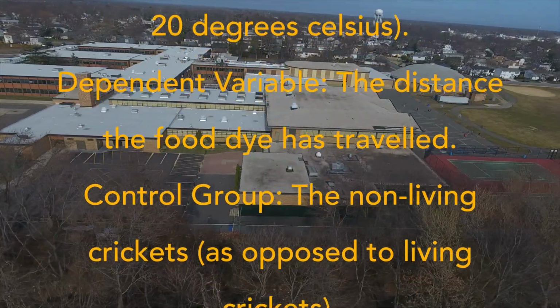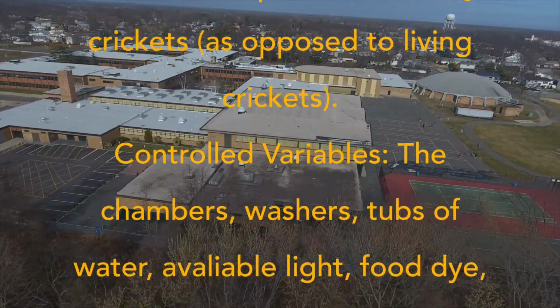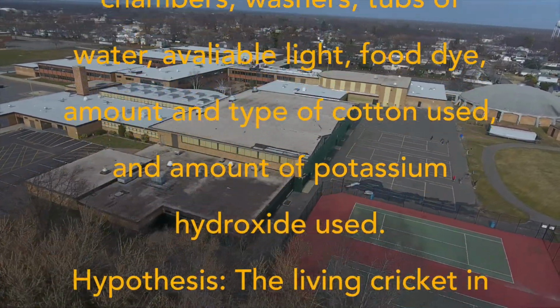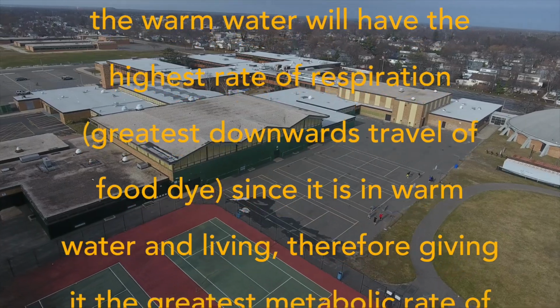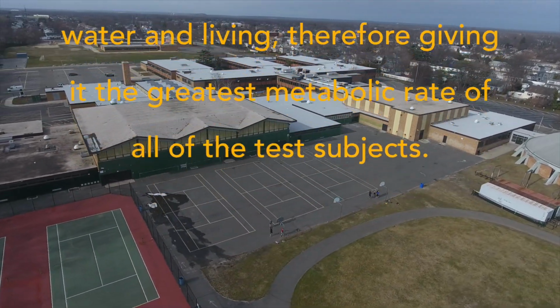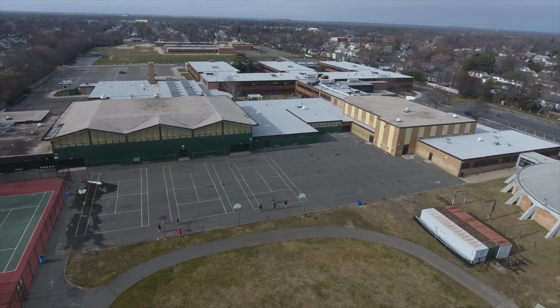The control group is the non-living crickets, as opposed to the living crickets. The controlled variables are the chambers, washers, tubs of water, available light, food dye, amount and type of cotton used, and the amount of potassium hydroxide used. And the hypothesis is that the living crickets in the warm water will have the highest rate of respiration because their metabolic rate will be the highest as a result of being in the warm water, because they are cold-blooded creatures.